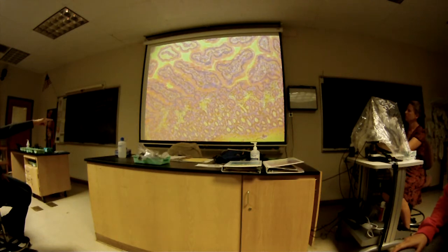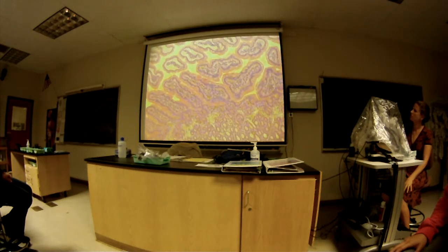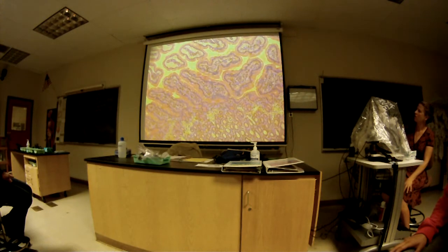What about that pink layer right there at the bottom of the screen? Does it go down? This? Yeah, that's the muscularis. Yep. So this is the sublayer of the mucosa. This is the muscularis mucosa. Okay. And above that are the intestinal crypts. Here's the intestinal crypts. Good job. And they're all the smaller ones on the side. Yep. More round, smaller. And then the things around the lamina propria are intestinal crypts too? Up here? Yeah, the surrounding of it. No, this is where you find the simple columnar cells. So let's go look at that.